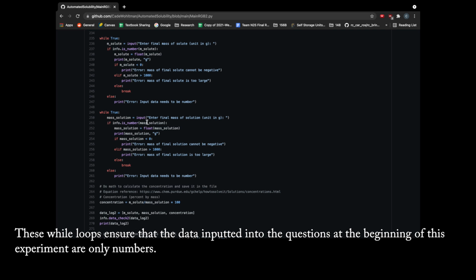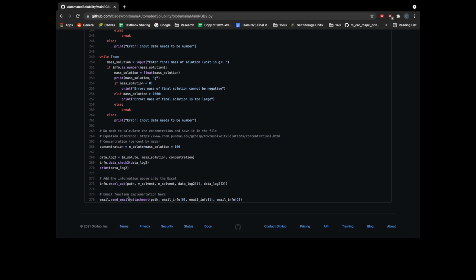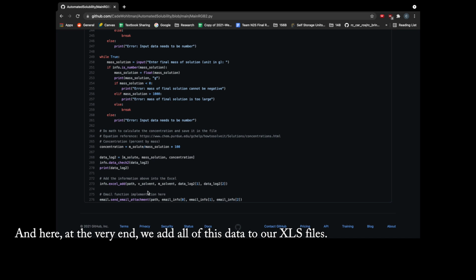These while loops ensure that the data inputted into the questions at the beginning of this experiment are only numbers. And here at the bottom you can see the parameters that the user inputted at the beginning of the experiment and the total volume of liquid dispensed in this experiment, used to calculate the concentration. And here at the very end we add all of this data to our XLS files.